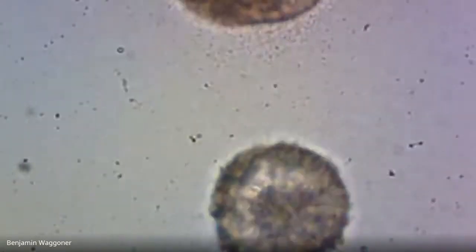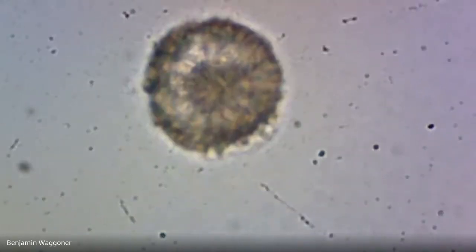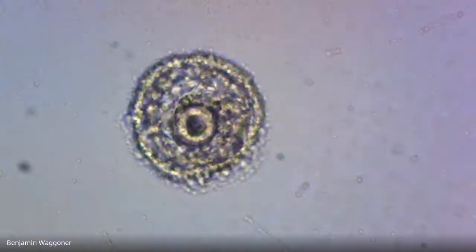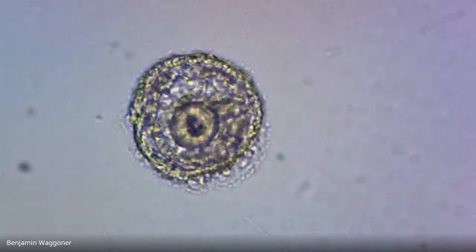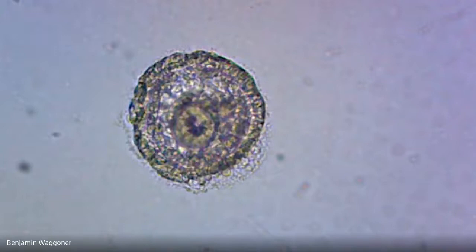Yeah, there's a whole lot here that look abnormal. On the face of it, I'm tempted to blame that on the nickel, but it's just hard to say whether it's the nickel or bacteria, which would go with things like low oxygen levels in the water.